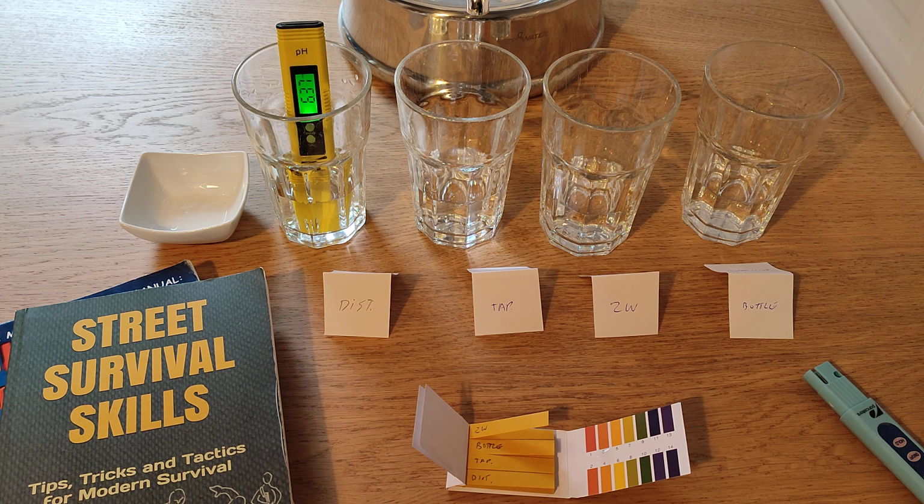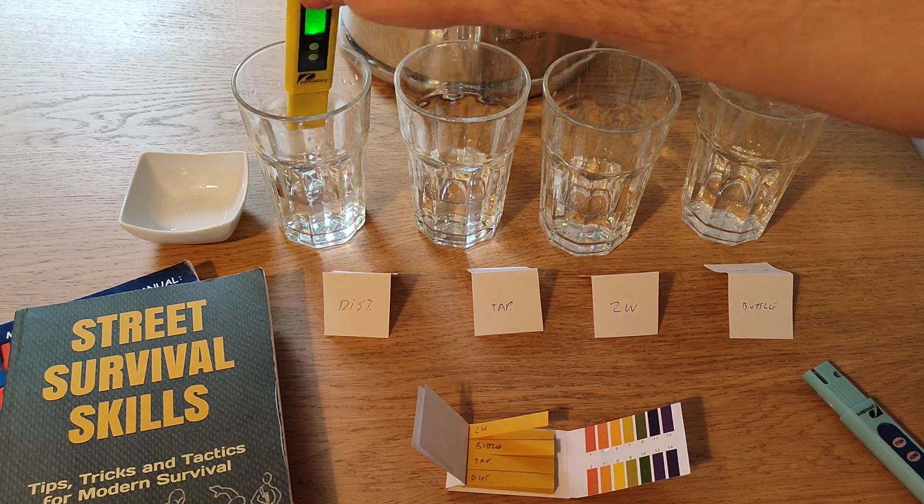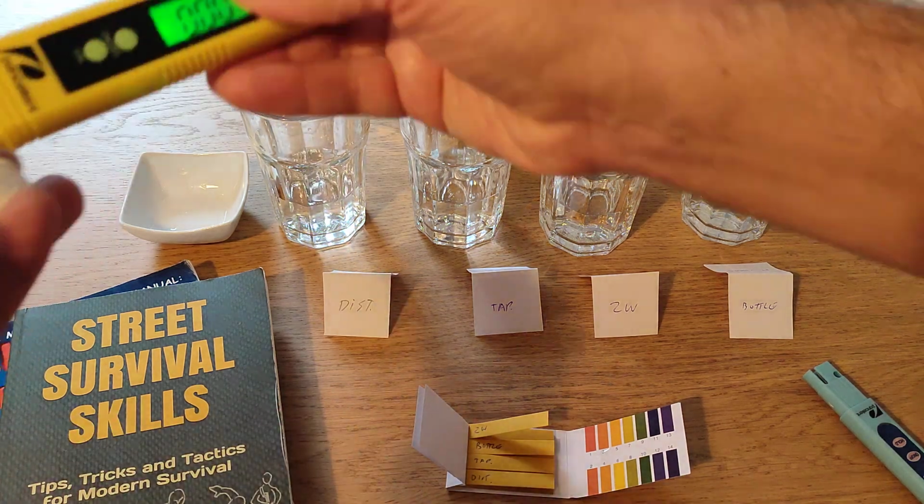So yeah, there you go. 6.37 seems to be where it's settling at. A little bit lower. Down until, yeah, there it is. 6.3. So that is actually quite accurate. Still dropping a little bit more. Okay, there we go. But we're going to be measuring it yet again with those strips.